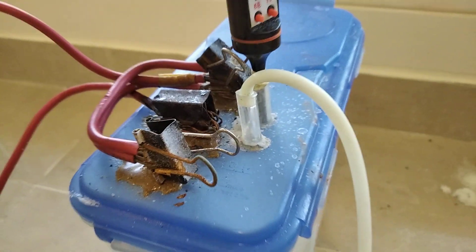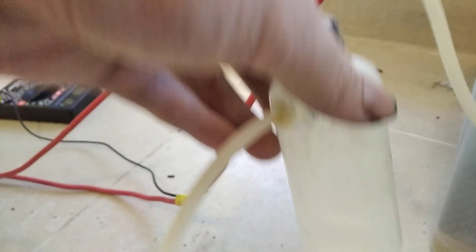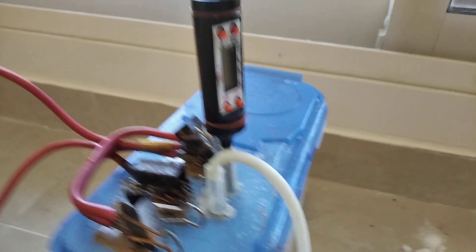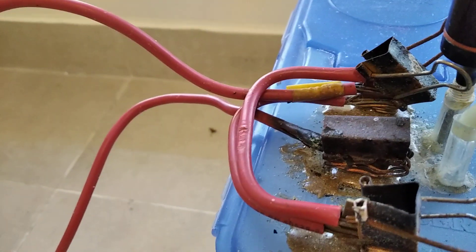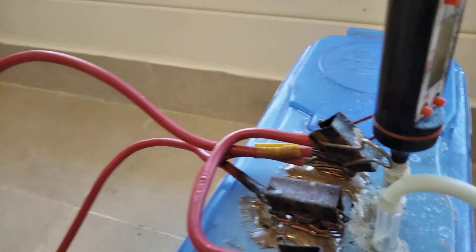The problem with that is it would condense in here and I'd just be wasting. So this demister actually collects the liquid which I can then open and put back into here but I'm not gonna open this right now for obvious reasons. So I have two ports. One is for the scrubber and demister. The other one is for the temperature measurement.